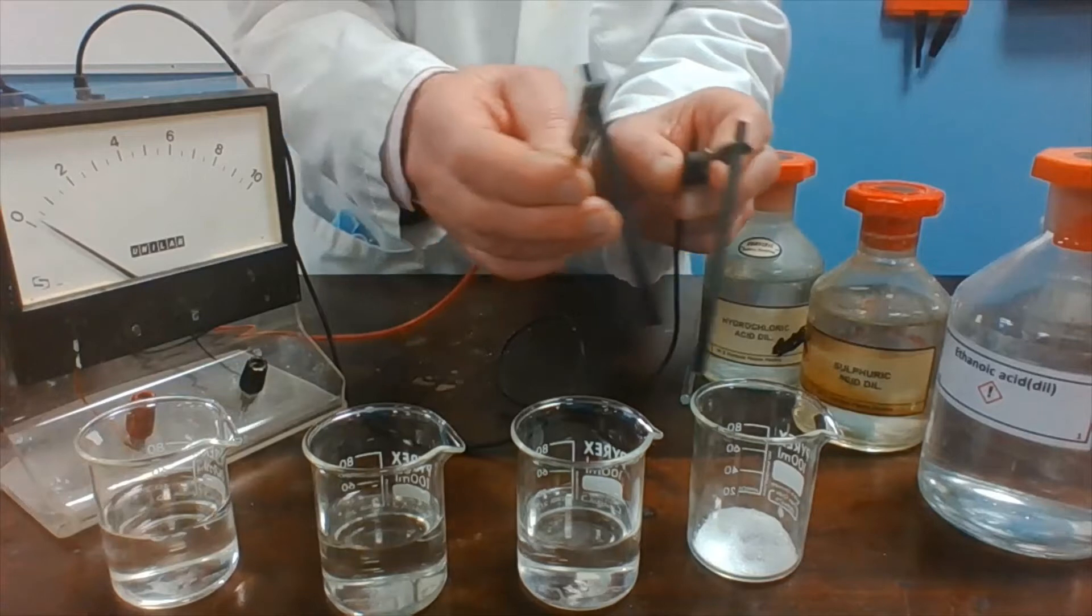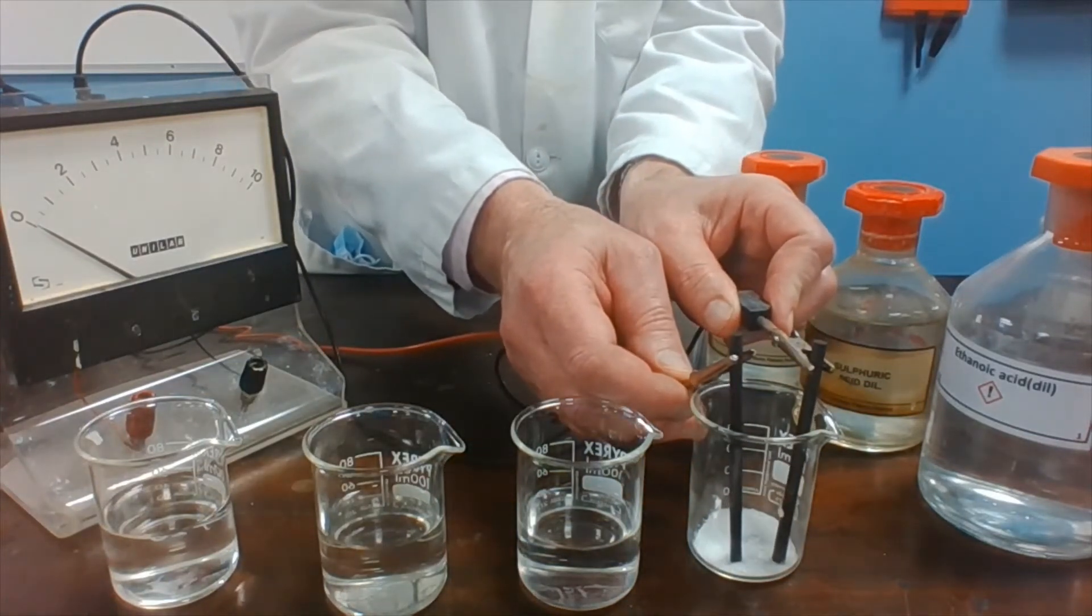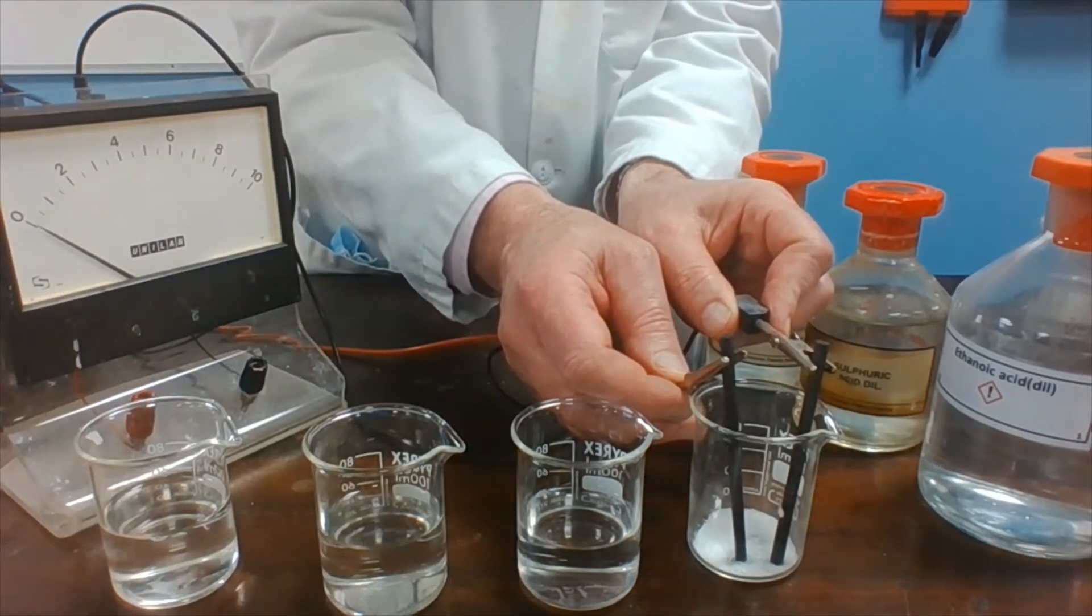And finally, into the citric acid. And there is no conductivity.